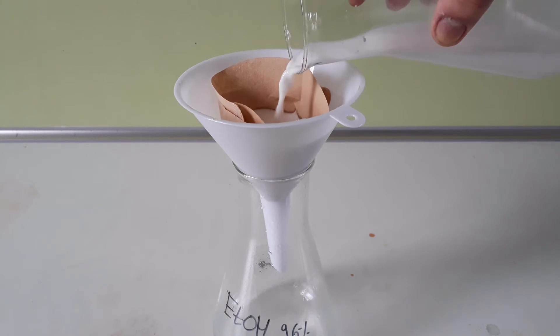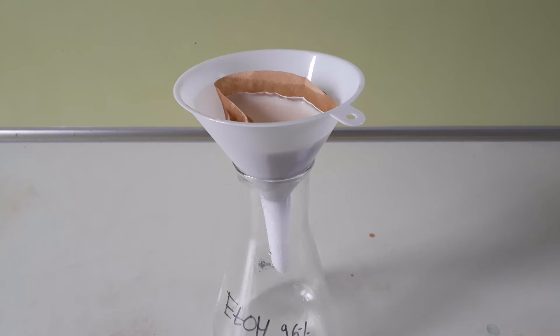After 20 minutes, I filter out the calcium peroxide, which has now some sort of a beige color to it, which comes through very terribly on the camera, actually.